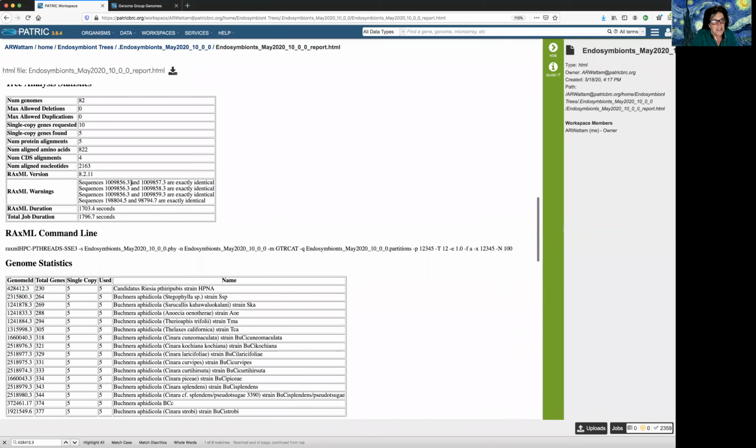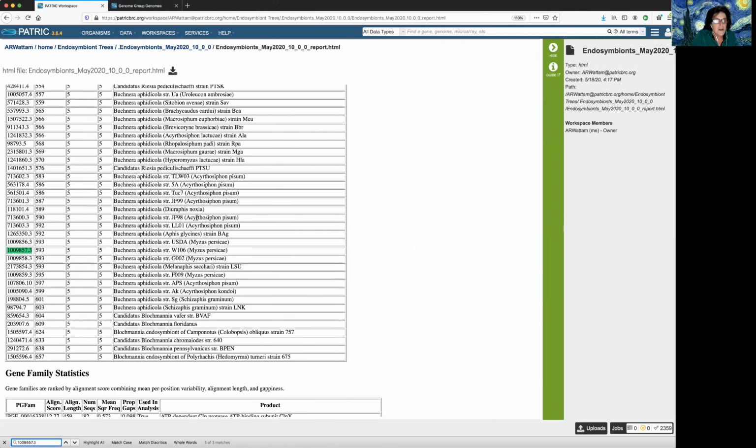So it says that this one, 1009856.3, is included here and here and here. And there are 3 genomes that are identical to it. So let's see who those guys are. Control C, I copy it. Control find, I paste it. I want to see who those are. Oh, those are Buchnera. So I have to go back to my Buchnera genomes, okay?